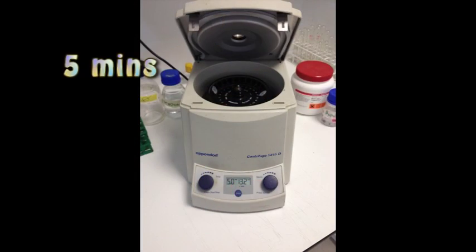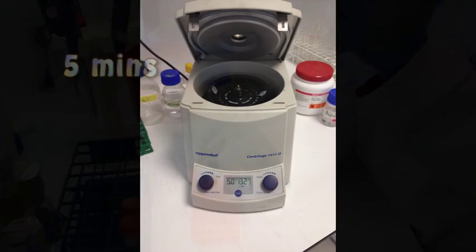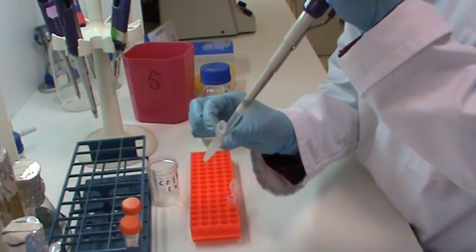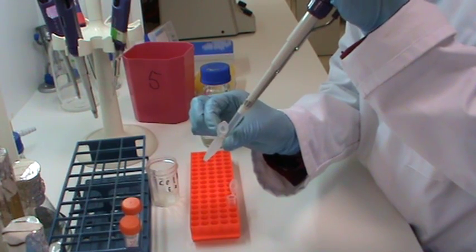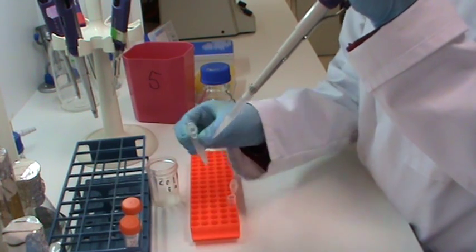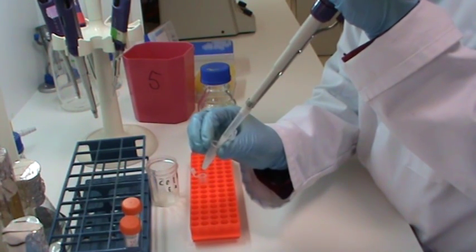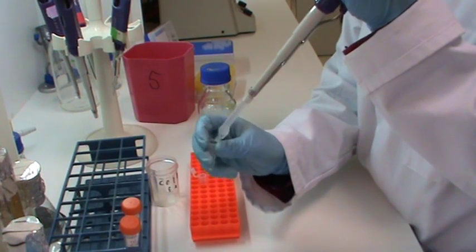After 30 minutes I am now placing the microfuge tube and the balance into the centrifuge again for 5 minutes. The DNA is now present in the liquid part, the supernatant. All proteins and cell debris are left in the pellet. I am now removing the supernatant and placing it in a new microfuge tube.